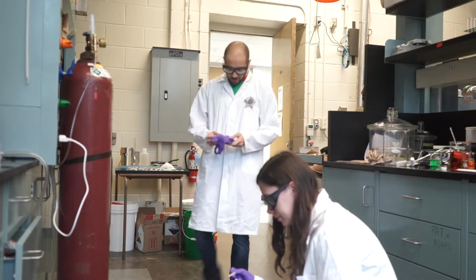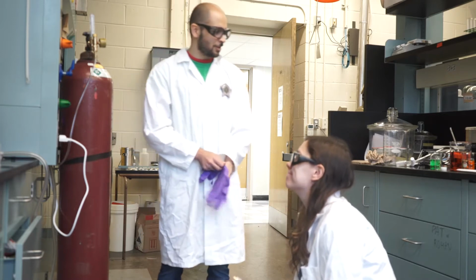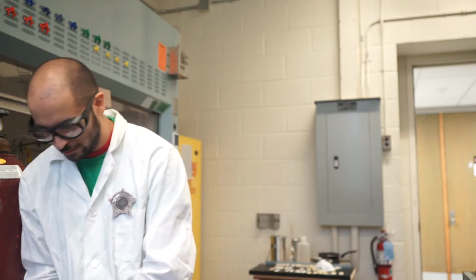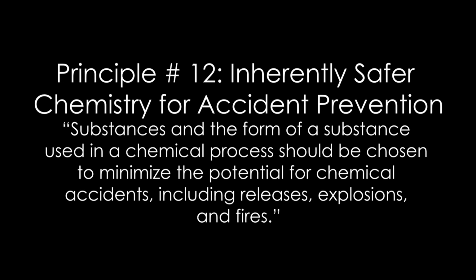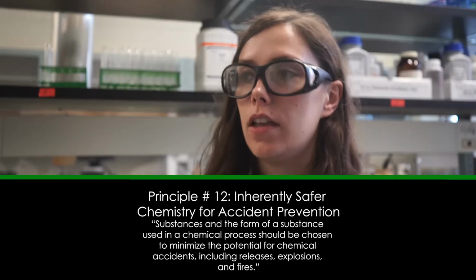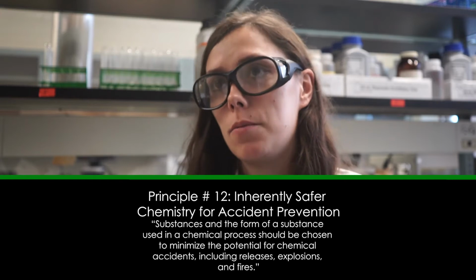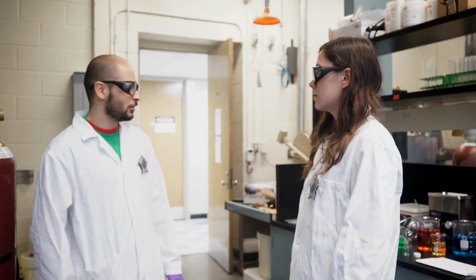What do you got from the detective cabinet? Nothing pretty, Detective Q. Not kidding. Whoever's running this lab has definitely never heard of the 12th principle of green chemistry. You mean inherently safer chemistry for accident prevention? Exactly. It states that substances and the form of substances used in the chemical process should be chosen to minimize the potential of chemical accidents, including fires, explosions, and releases. Yeah, I'm familiar with it. You minimize the risk of accidents by developing safer procedures. Show me what you got.